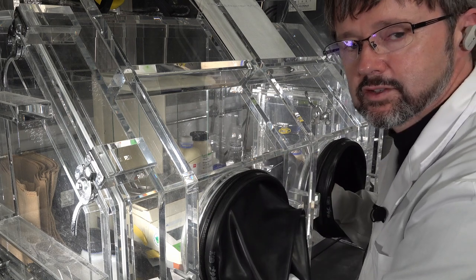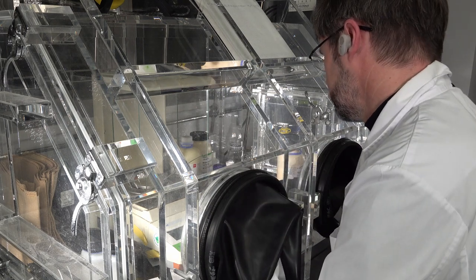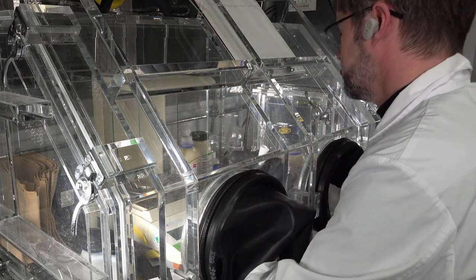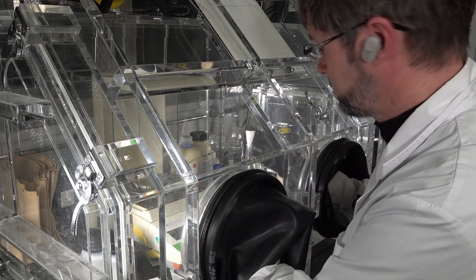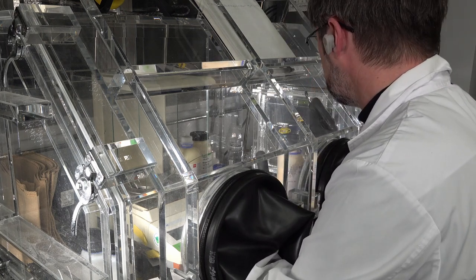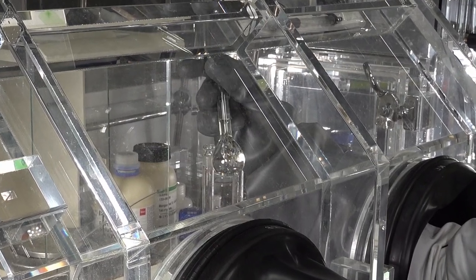Okay, right, it is all in. Give it a shake, make sure it's in there. Usually you add a solid to a liquid, which is what I usually do here. I didn't do it today, and that saved me an awful lot of time.